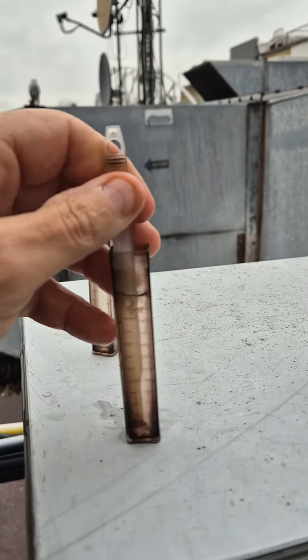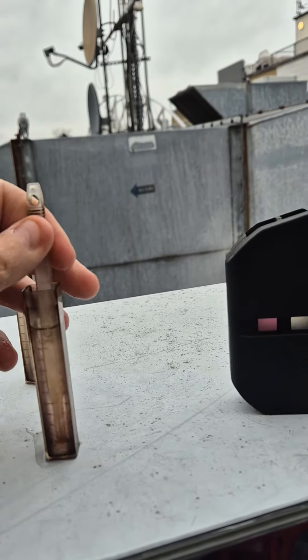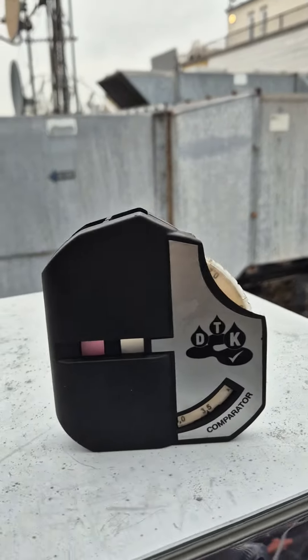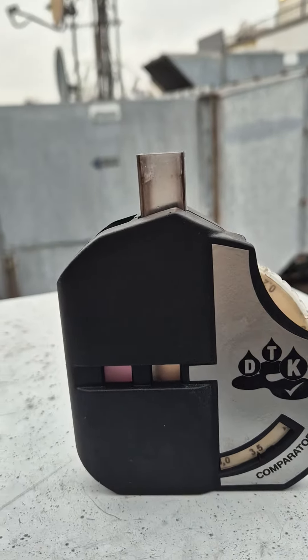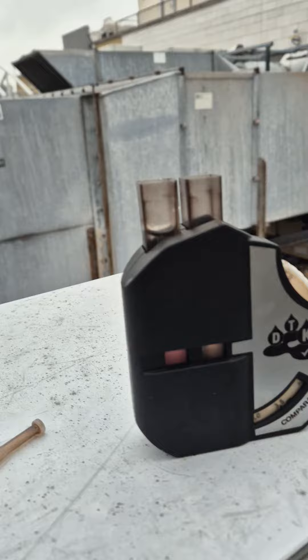This is really difficult because I'm holding the phone and trying to see what I'm doing. Give it a shake, then stick it in your tester. You've got one side which is the clear side — stick it on the clear side. The water, the second sample, sticks on the other side.